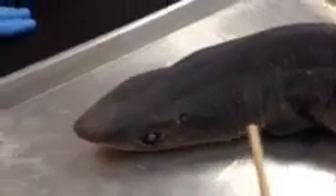And then we have the lateral line canal that starts here and then it goes around. You can follow the line.